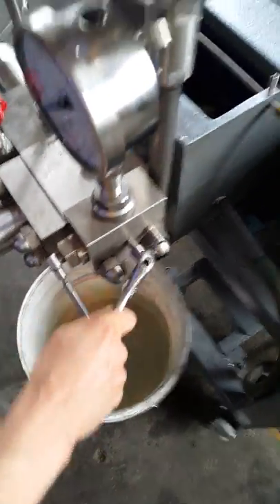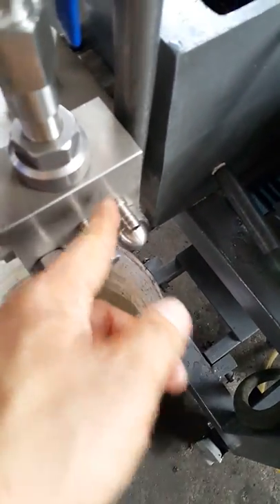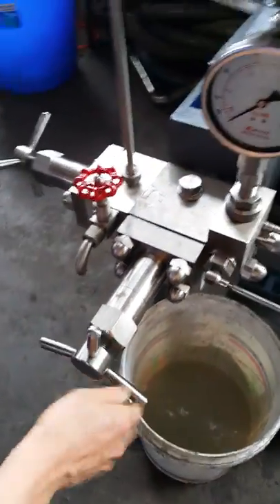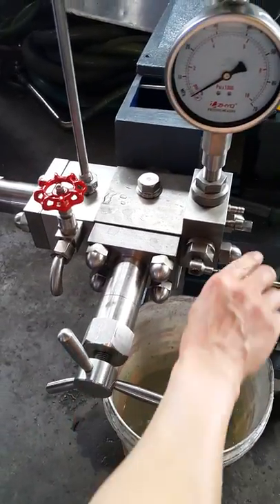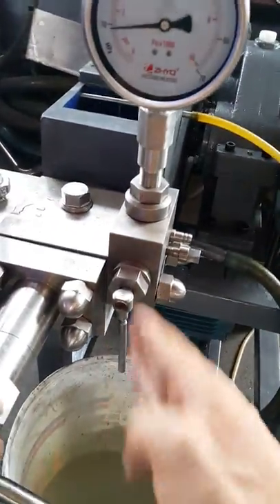If you become worried about air entrapments, release this and then the water comes up — keep it open. Then lock it back; tighten this valve until you get a little bit coming out. Then turn off this gate valve to the off position.